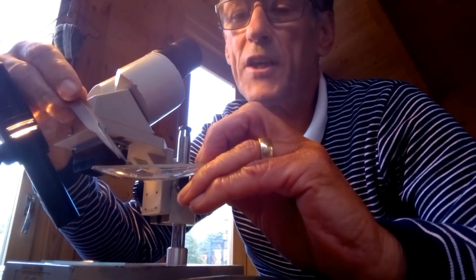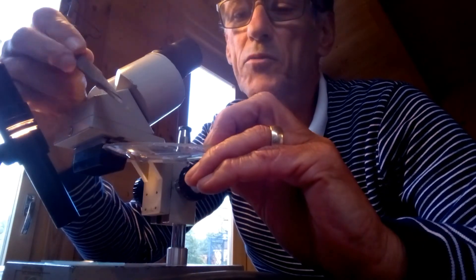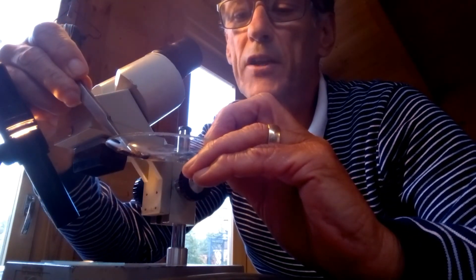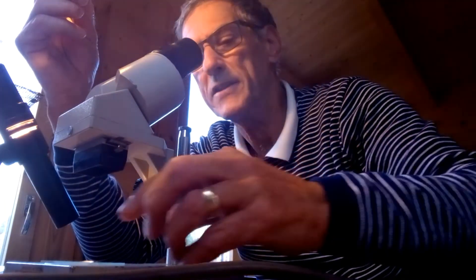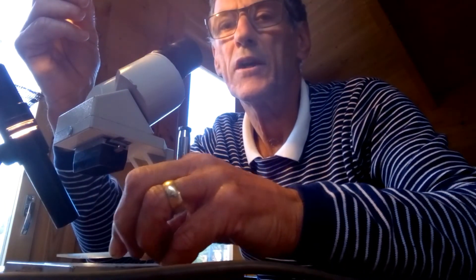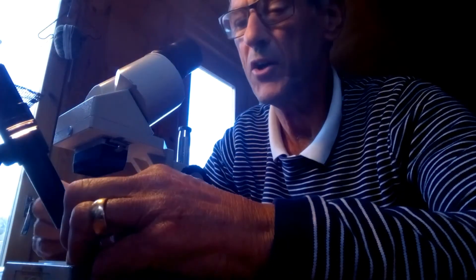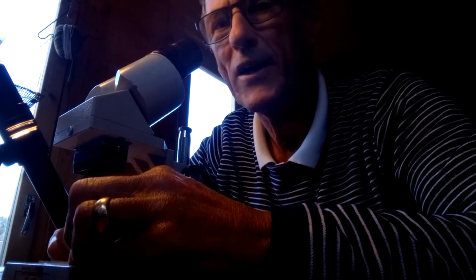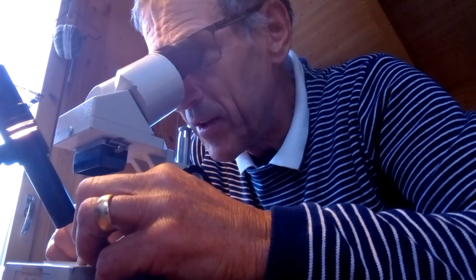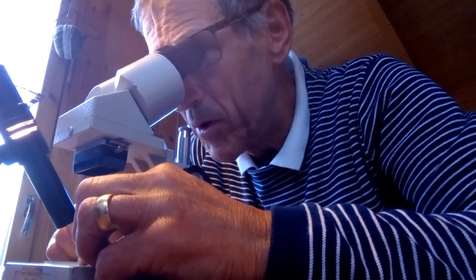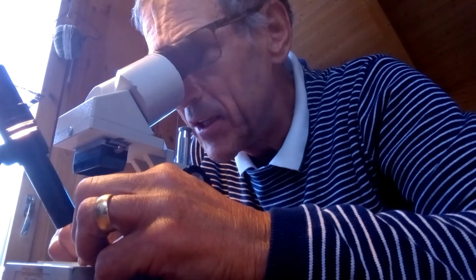So what I've tried to do then is I've taken the leaf here. Using my tweezers, I've just pulled off a tiny little bit of the leaf from here. And then I've placed that onto a microscope slide here. And then I've just spent a little bit of time just breaking that up using the tweezers.